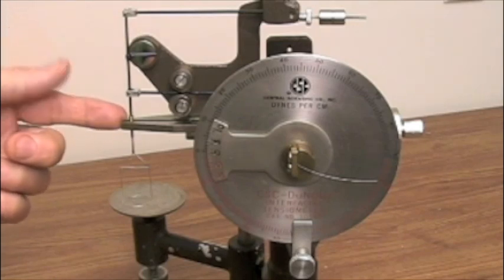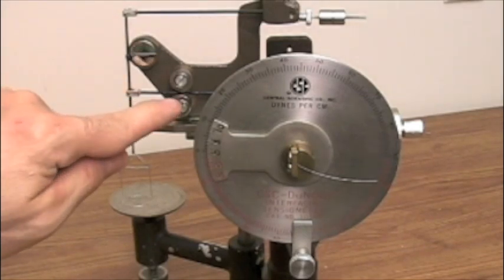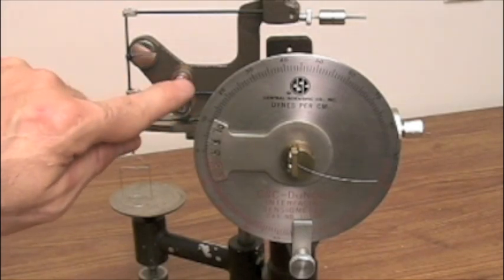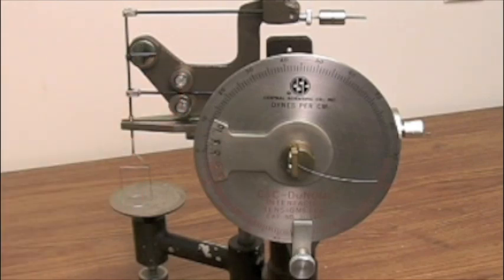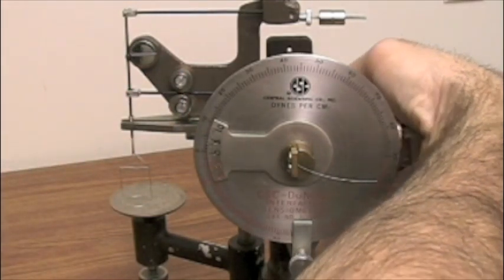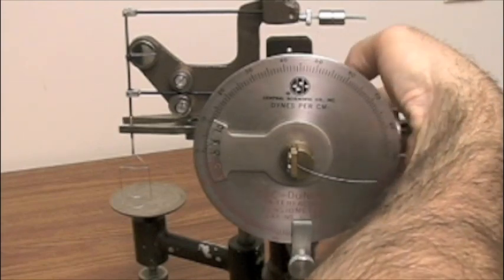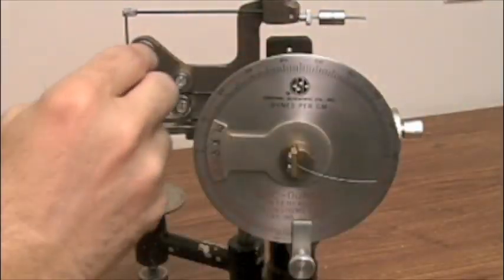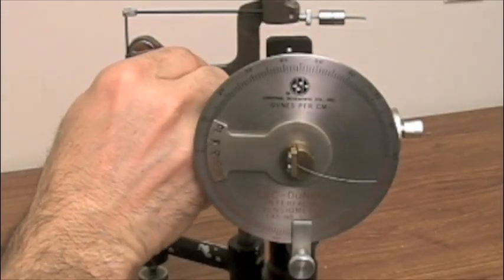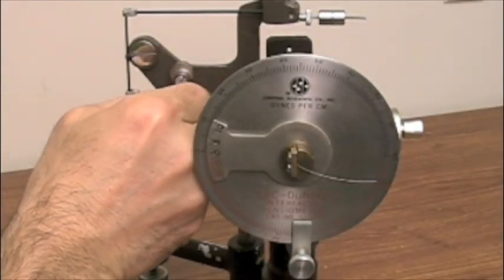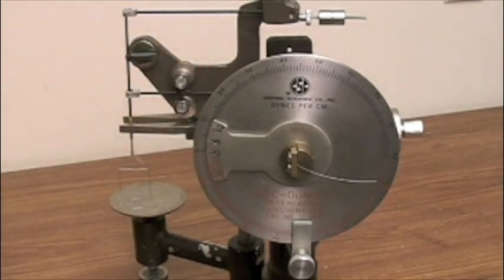Notice that the clamping lock, the clamp, is in place and we have our two screws for immobilizing the torsion arm. Now that the ring is in place we can go ahead and loosen the clamp so that the vertical arm can move freely and we open that all the way up. We also position the screws so that there's freedom of movement for this torsion arm.